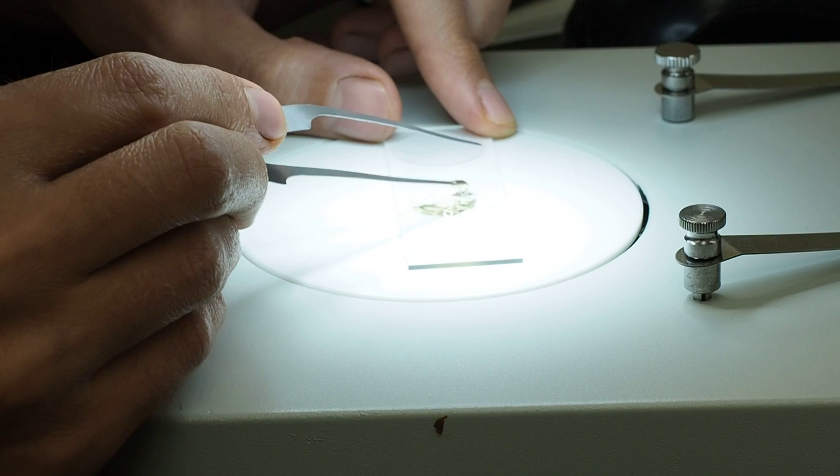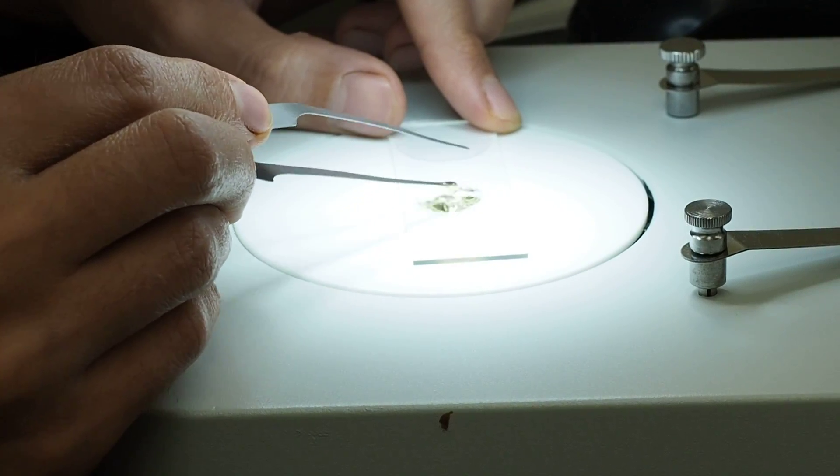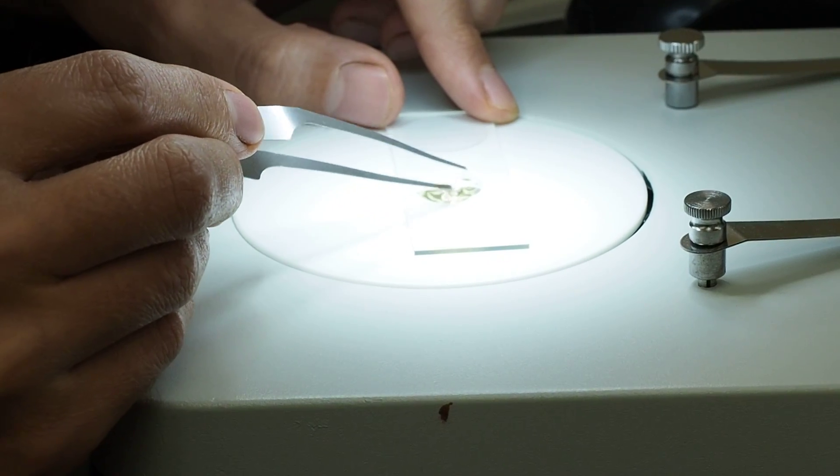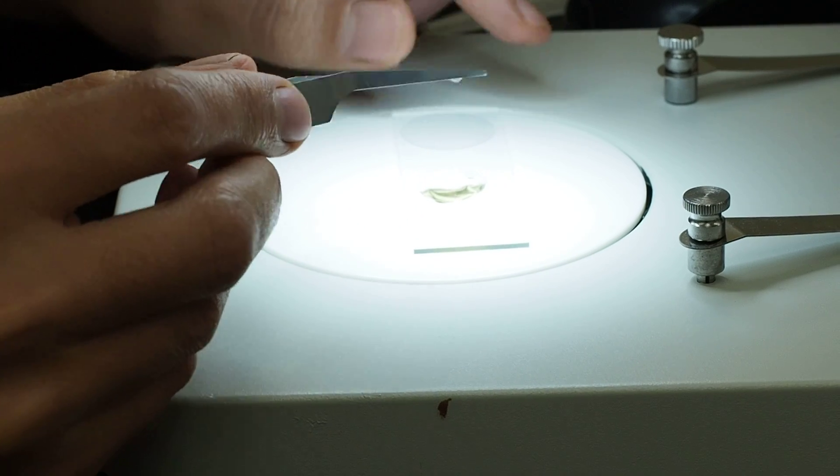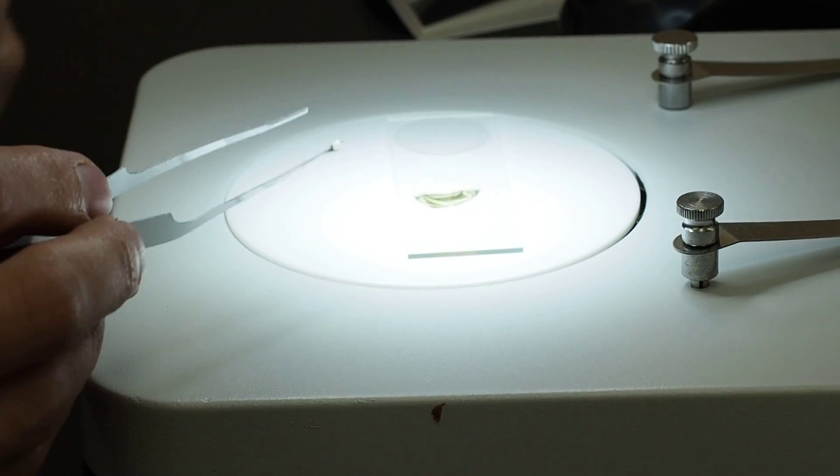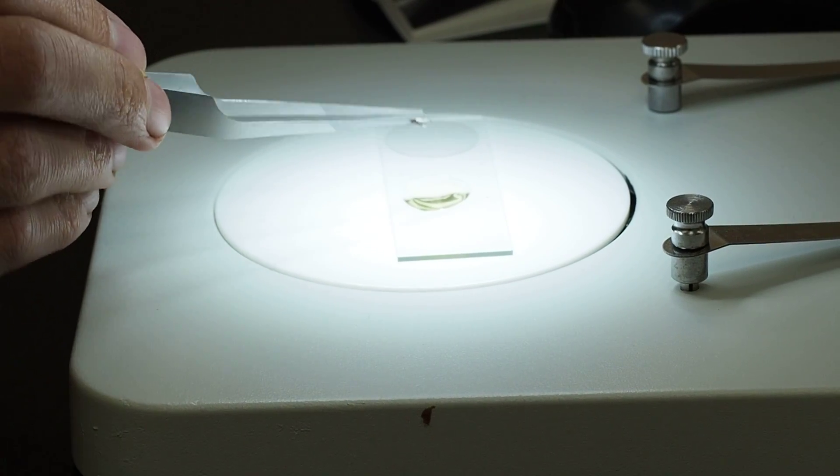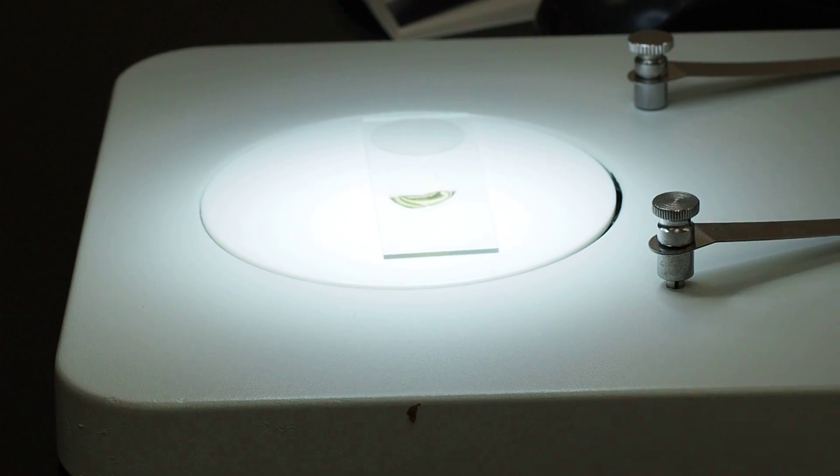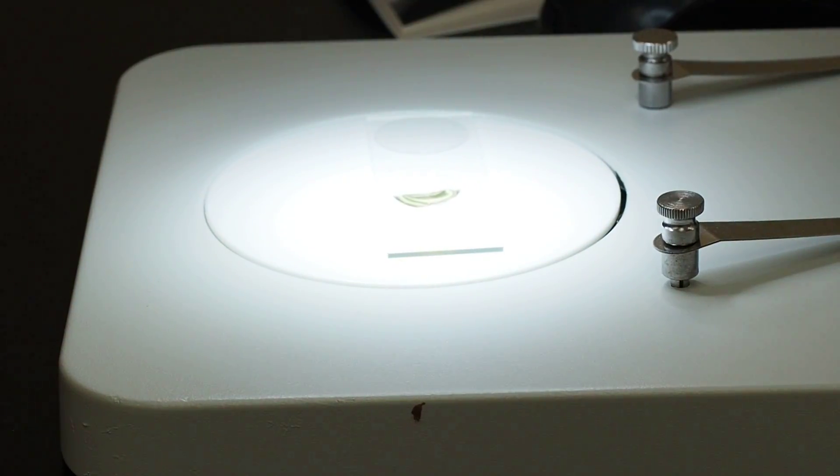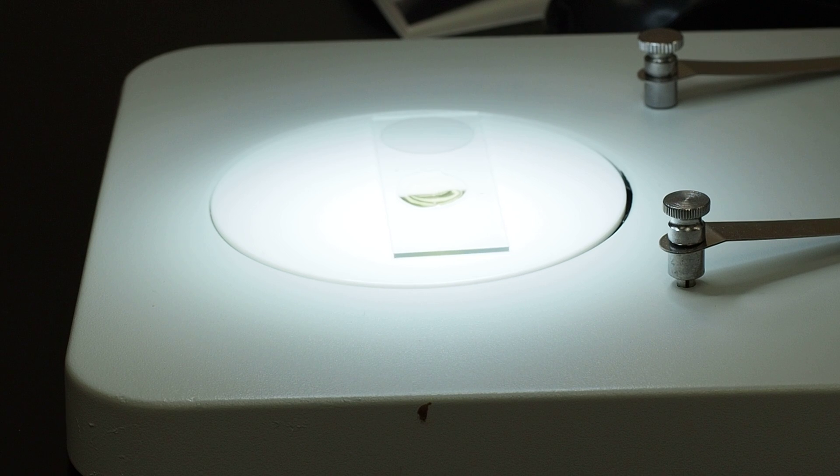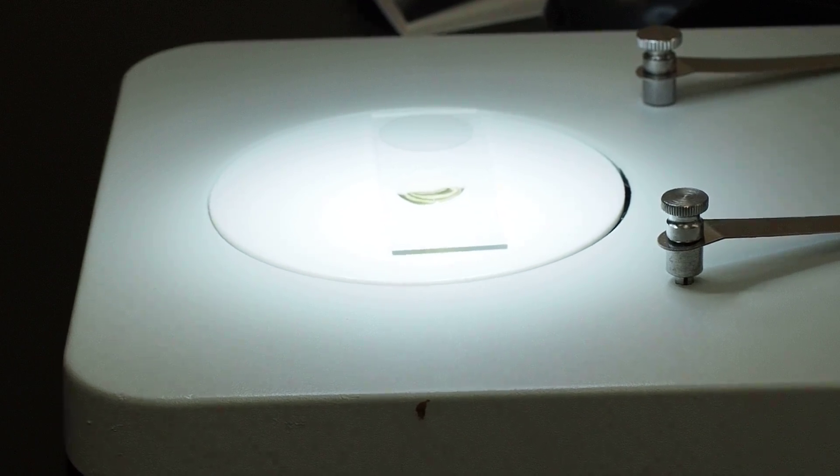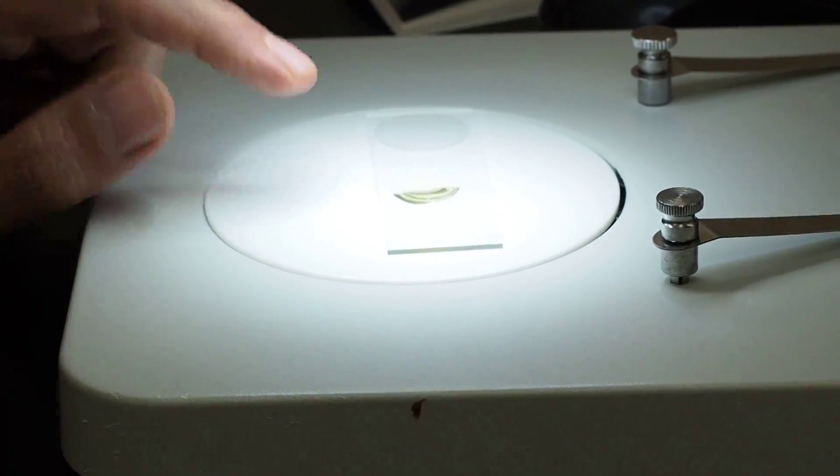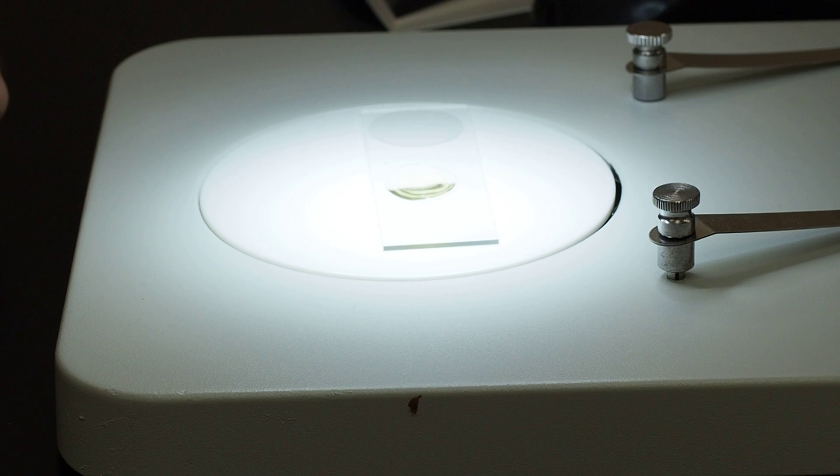That'll still work. Yeah, so we've got a big old gob of Canada balsam. All right, so now we're ready to add our specimen. And this will stay flexible for a really long time and eventually it'll harden.